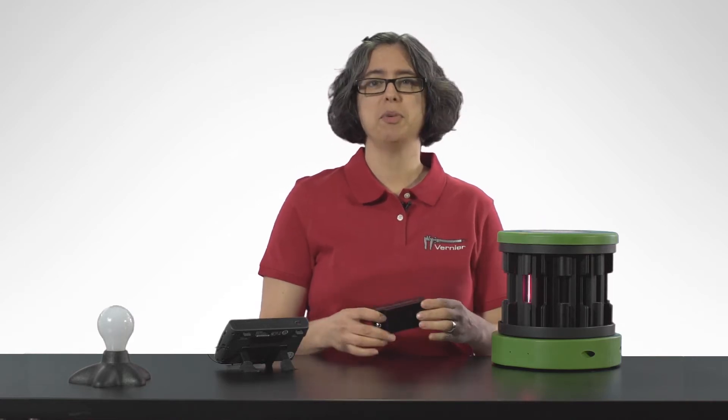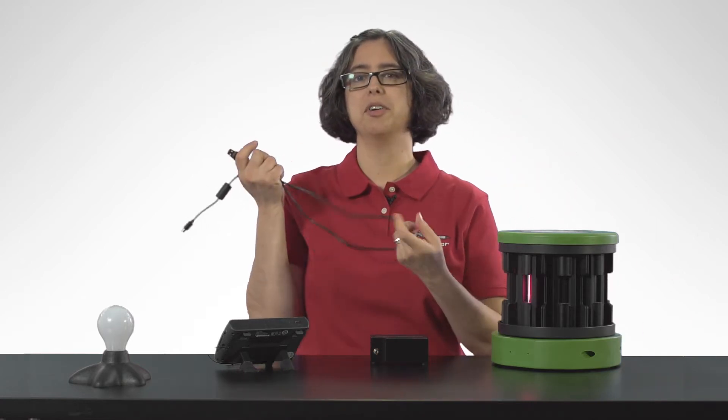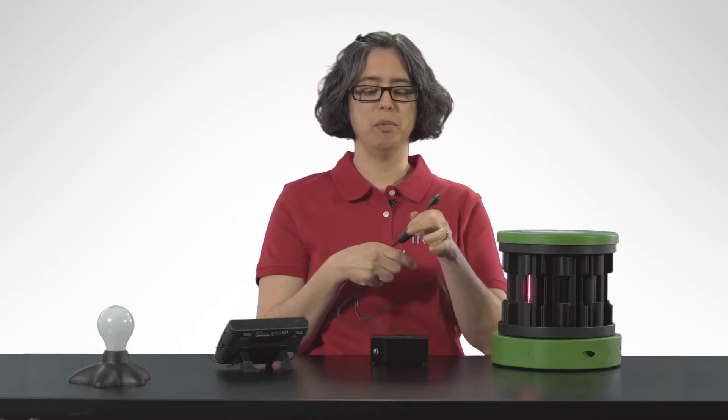The Vernier Emission Spectrometer connects with a USB cable to your computer or to LabQuest. I will connect it to the LabQuest too.